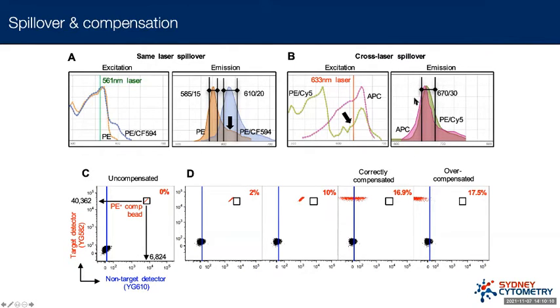So the way that we deal with this is we address the problem computationally. We actually ask the computer to help us out. In this example, what you can see is what the data looks like uncompensated, so raw. We haven't made any changes yet.